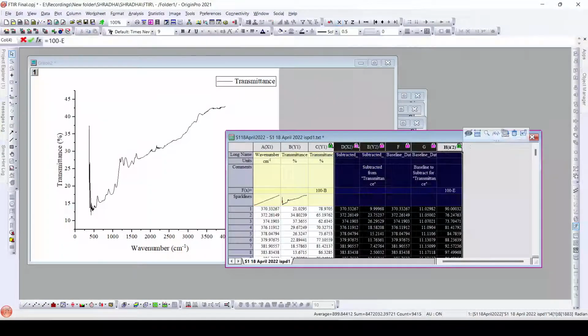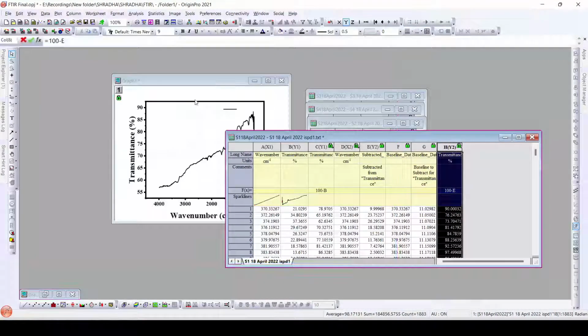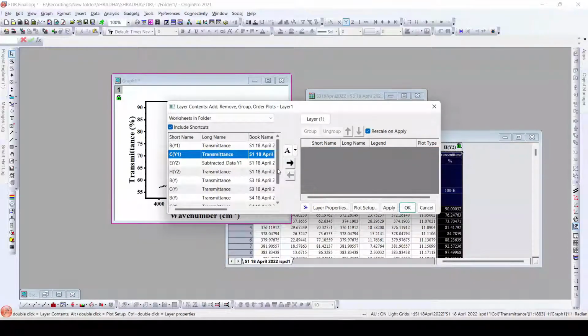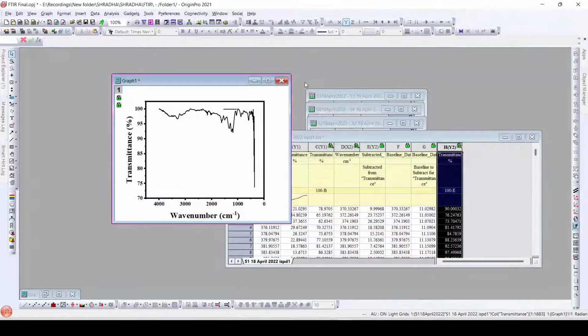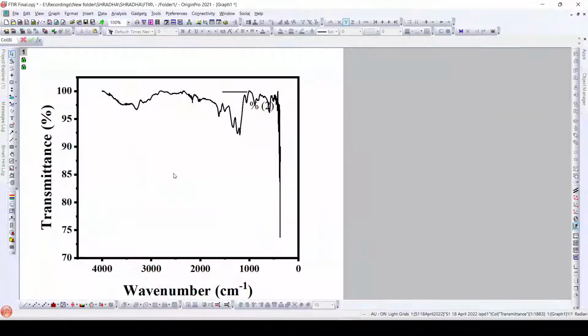Here we have to plot this, but before plotting, I will copy the long names and units to these values here, as well as transmittance to the H column. Now when we plot this into our template that we have already created here, I will remove this and plot the H column. Apply. Okay, so here it's the corrected data. So in this way we can create a baseline, as well as plot the FTIR data, and add a baseline to that particular data.